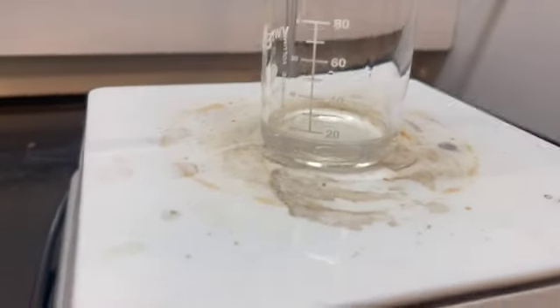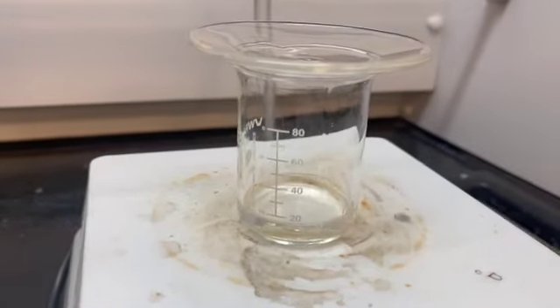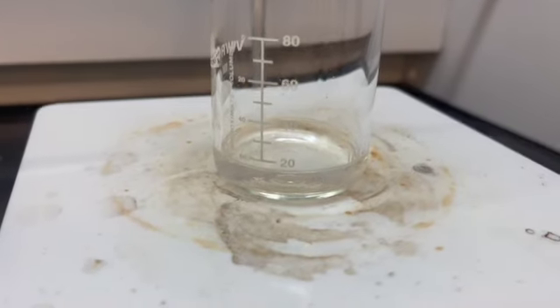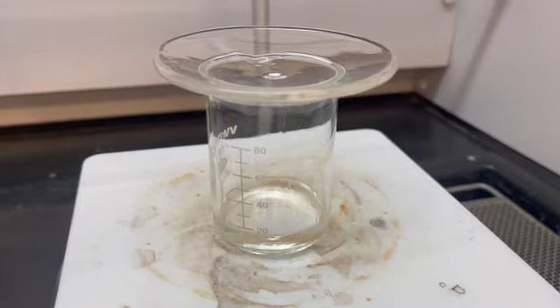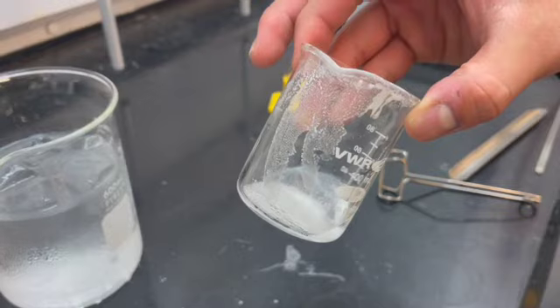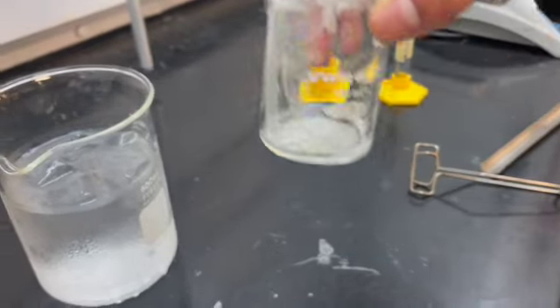Now that our solution is no longer boiling and has no more solid, we're going to go ahead and put it into an ice bath for at least 30 minutes. After getting our solution to room temperature, we're going to put it in the ice bath to recrystallize more.